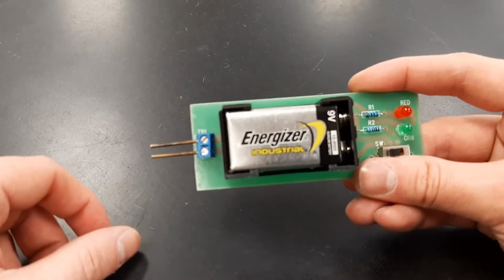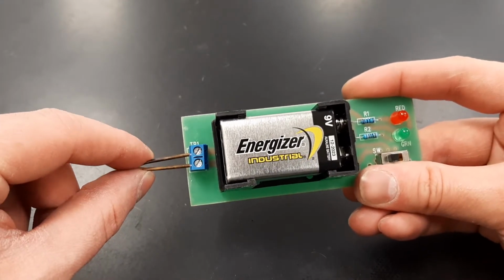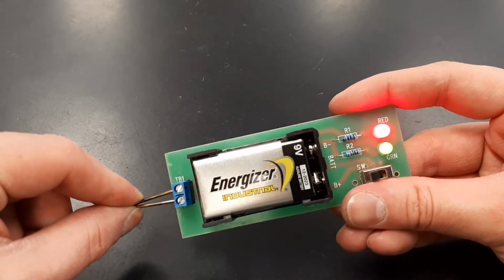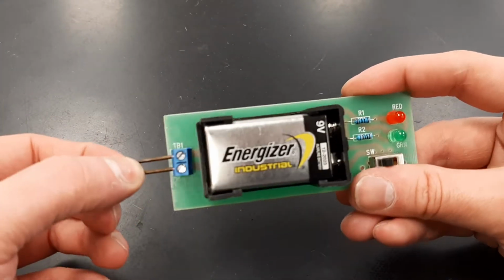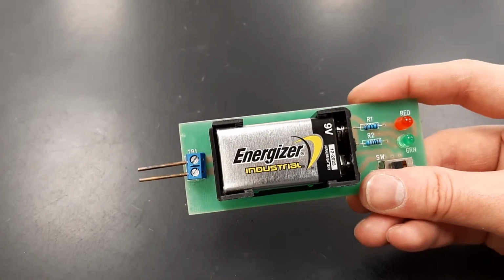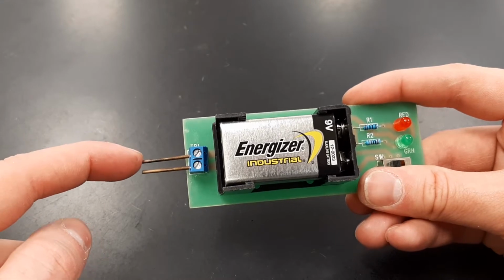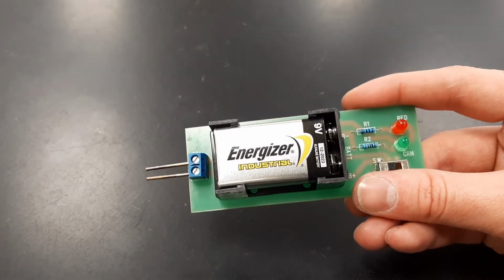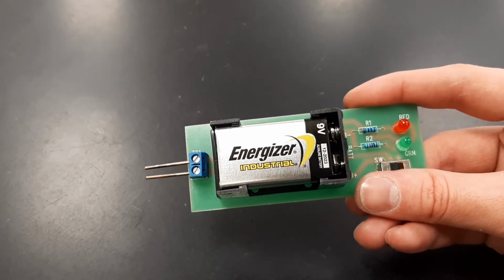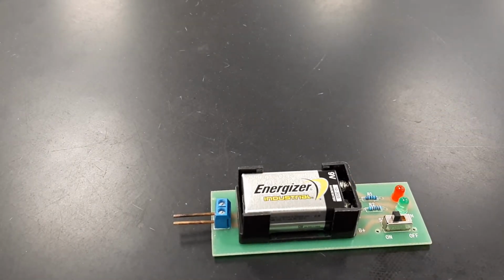What that means is that basically if those two leads, these two copper leads, were to touch, the lights would turn on because a circuit is created. That's really what's going to be occurring with some of the conductors. If it somehow makes a connection between one of these metal rods and this other one, it will complete the circuit and the lights will turn on. So we're going to be doing that with this conductivity meter with each of these substances.